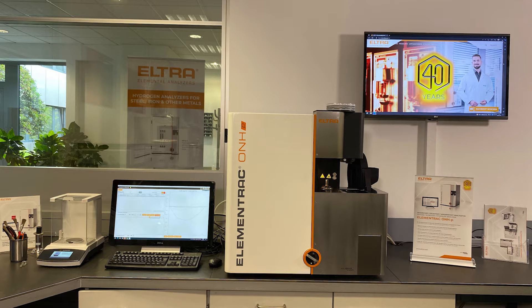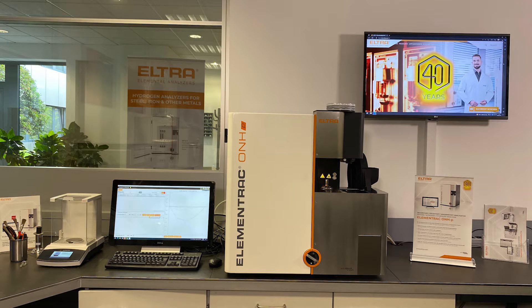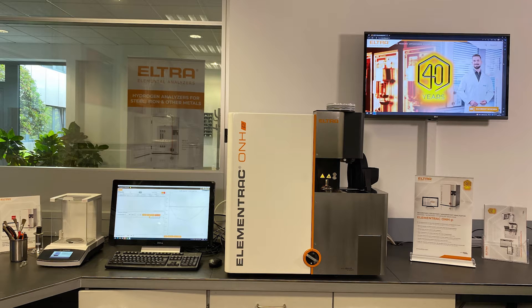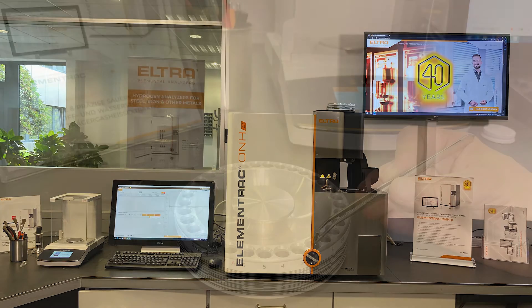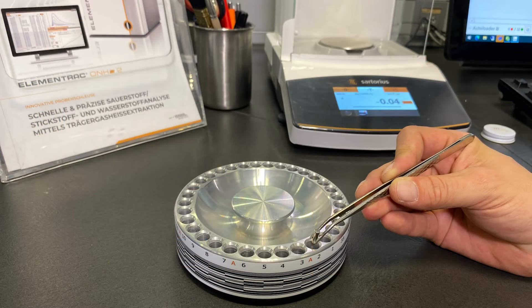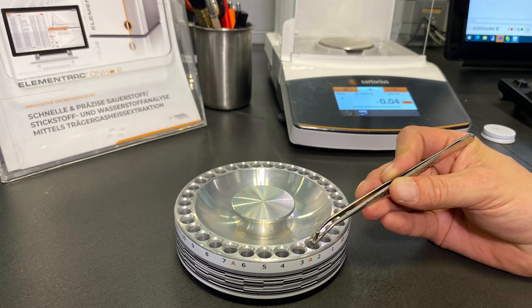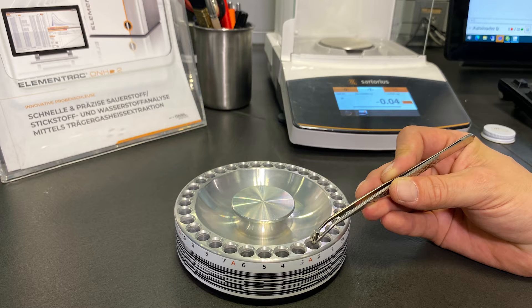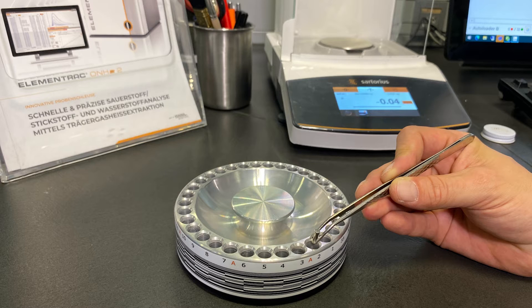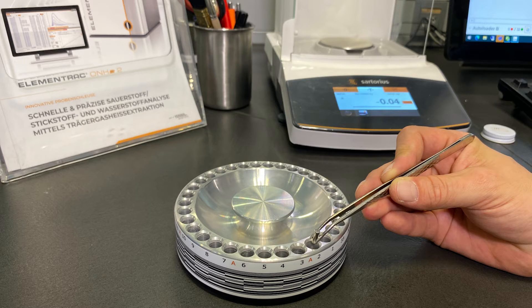Today we would like to introduce our new auto loader for our Elementrac ONHP Analyzer. The sample carousel has 32 positions and can be easily removed from the analyzer for convenient filling.